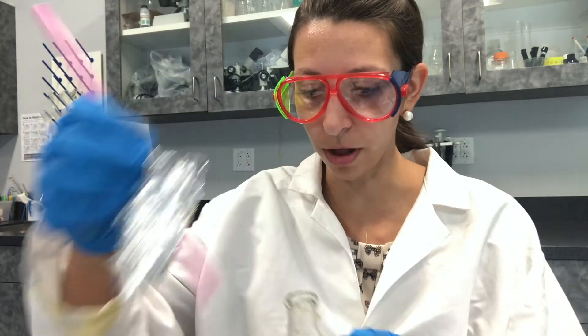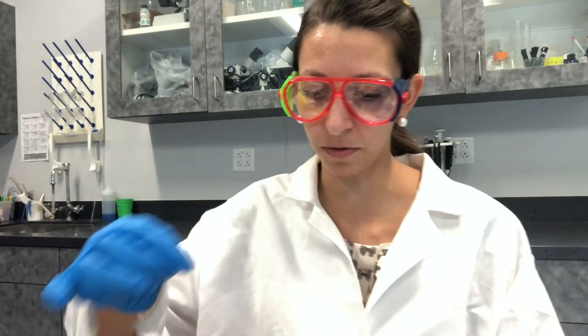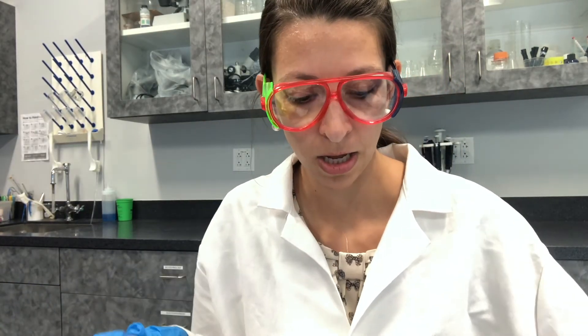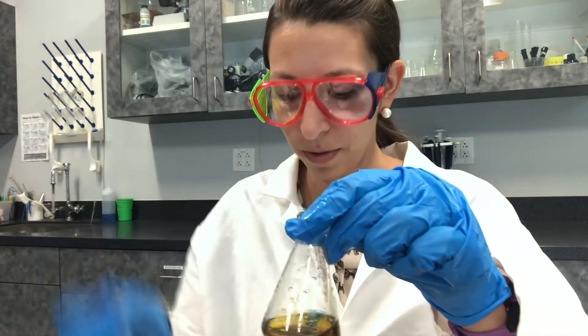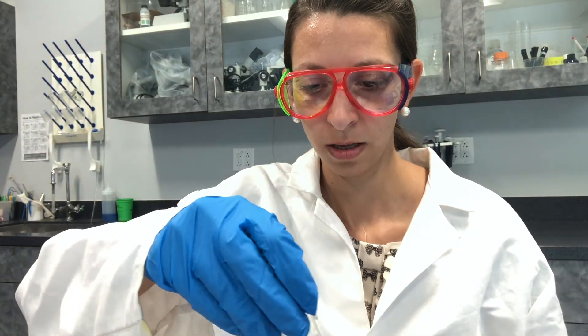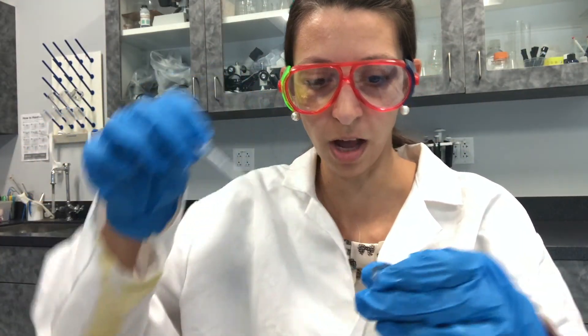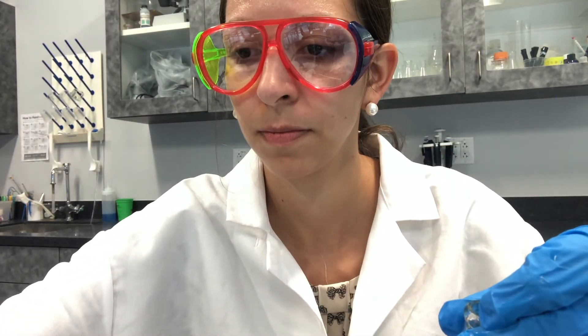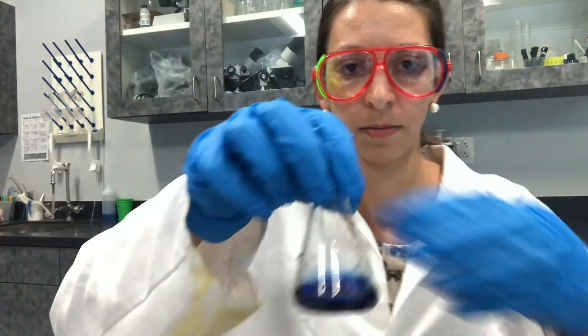All right, that is time. Now we're going to do the same data collection again. Carefully remove your straw and foil and get out your sodium hydroxide, and we're going to count the number of drops it takes to turn our solution back to that bluish-green color. You can see it's very yellow right now. One drop — not quite there yet, still kind of greenish-yellow. Two drops. Three drops. All right, looks like that time it took three drops of sodium hydroxide to get it back to that blue color.